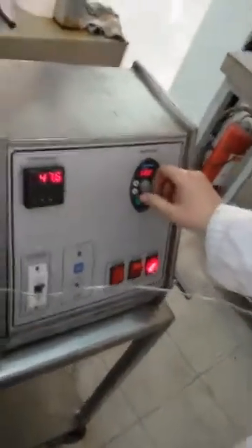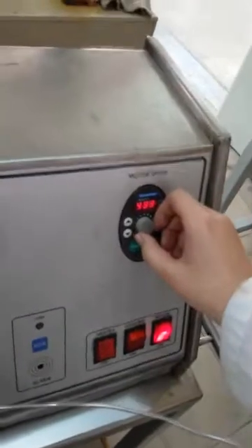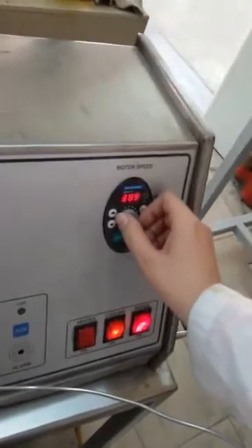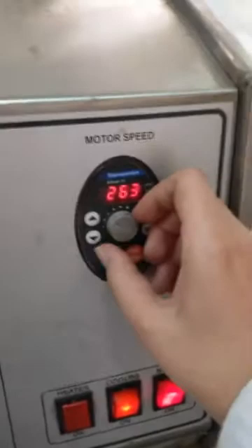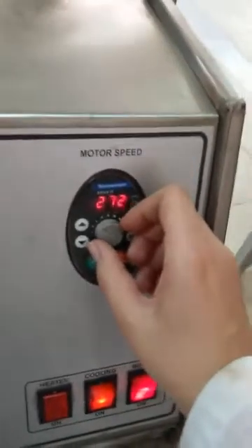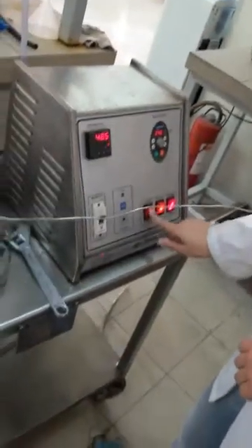You need to turn on the motor. And this you can use to adjust the stirring rate — I will set it like that. And also turn the heat on.